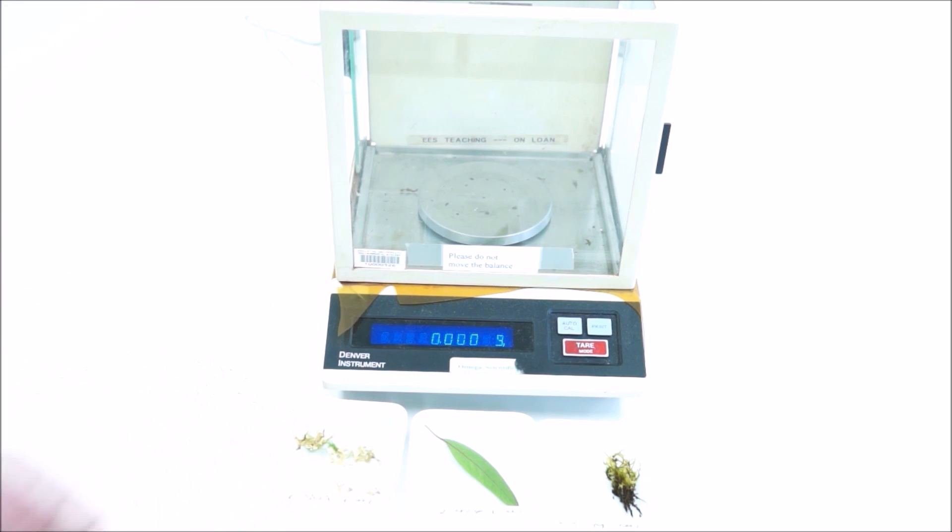You'll be taking five measurements all up. This is the time equals zero measurement. Just leave them on the bench for half an hour and then you'll take your second measurement.